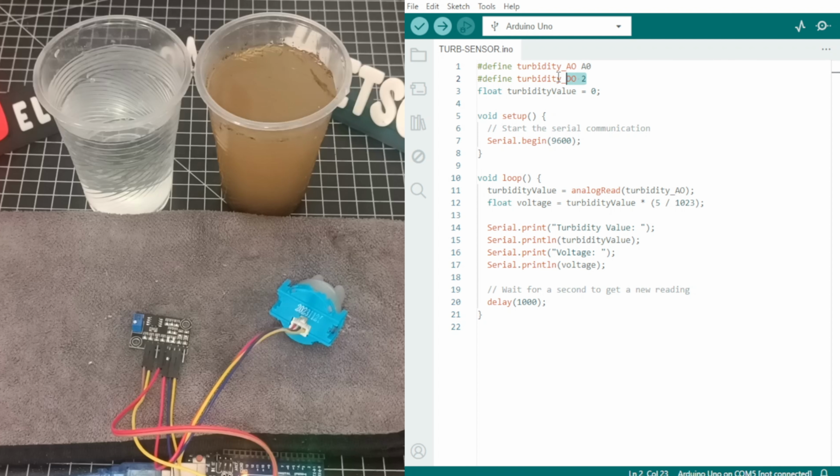Define the connected digital and analog pins of the turbidity sensor as well as a variable to store the reading from the sensor. Proceeding to the setup function, initialize the serial monitor for debugging and logs. Proceeding to the loop function, read the analog output from the sensor, convert the read value to voltage using this formula, and print the turbidity value and calculated voltage to the serial monitor.